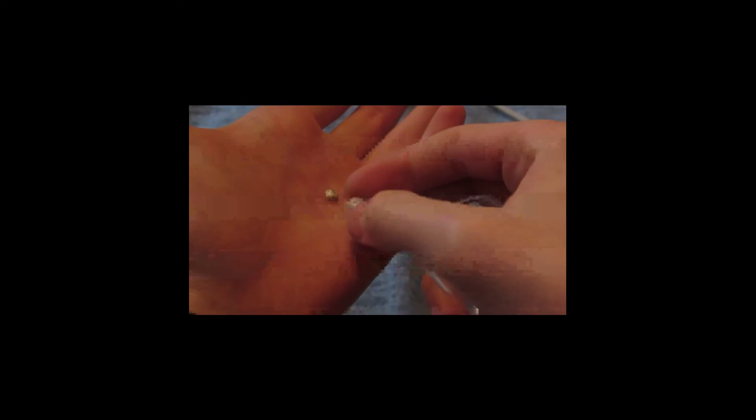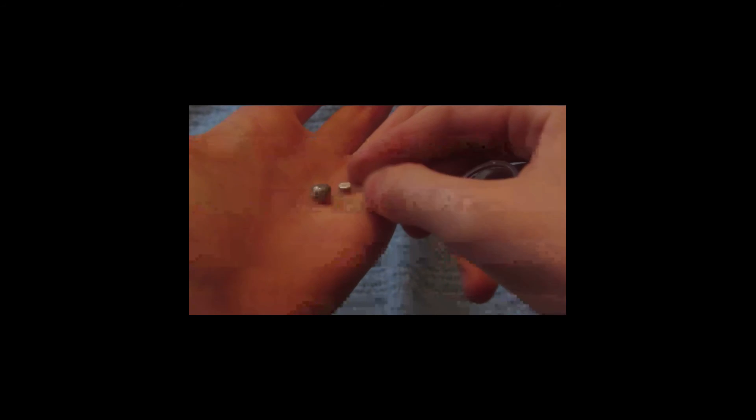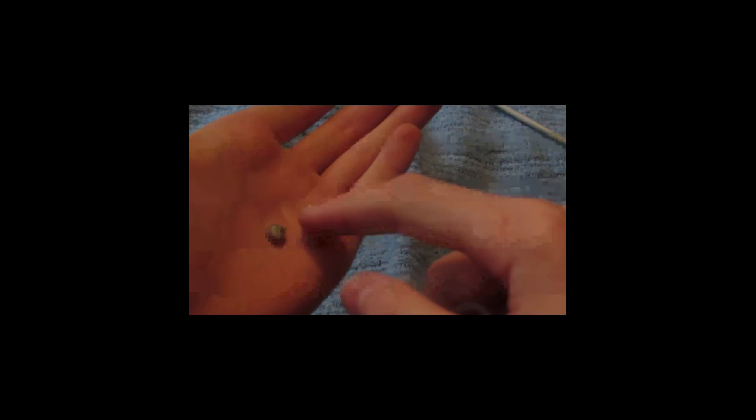Okay, so you can see here's the bead that we just got. From last time we made silver, there's that bead. So this is what was stuck in solution — a huge amount. This itself weighs one gram. I'm not sure how much this one reads because I only have a scale that measures in grams, not anything smaller. But this is one gram, so that's a huge amount of silver that was in solution. You can see it's a lot duller and not as nice because I melted it with a propane torch on top of a piece of aluminum or steel from a steel tin can, and whatever coating they had came off and stuck to the surface of my silver. So I highly recommend not doing that — just use your arc furnace if you have one. In the previous video I used the arc furnace on this one, and you can see it's beautiful. So I'll probably redo this with my arc furnace to get a nicer sample.